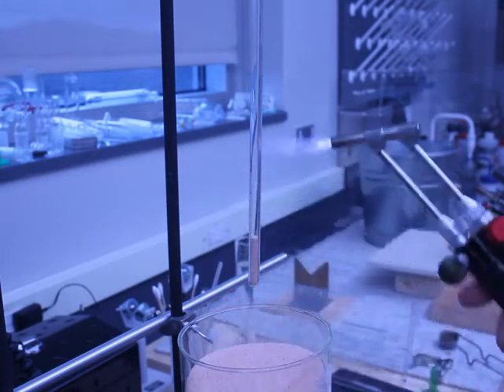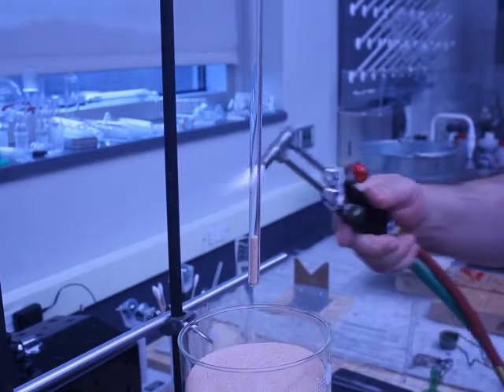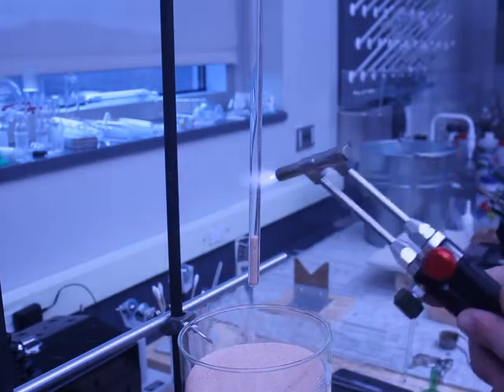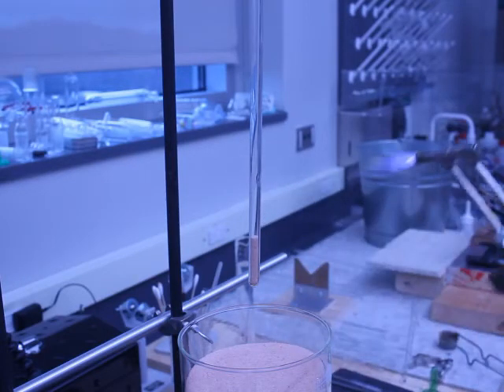Underneath the sample, I have a little sand bath, so that way when the sample needs to drop, I've got a safe place to put it. Many times we would use liquid nitrogen.